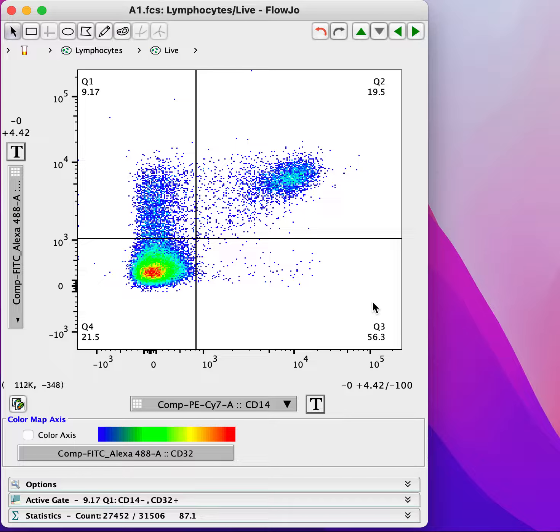So I just want to illustrate how sometimes changing the scale on your flow cytometry data can lead to misleading representations of your data. And so here we've got a plot with a fairly typical distribution with a clear negative population here, a very well separated positive population over here. We've drawn our quadrant gate to reflect where we think negative and positive lie.